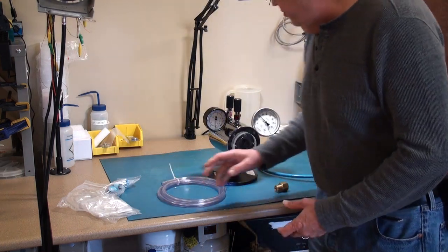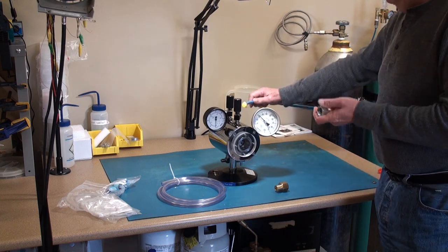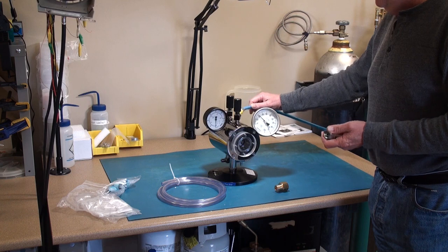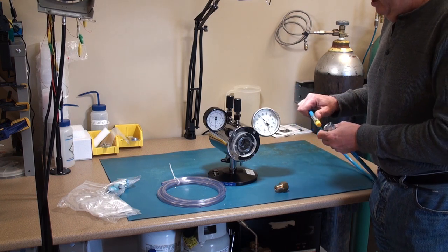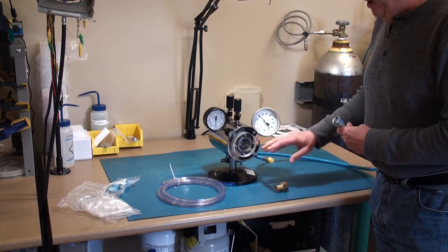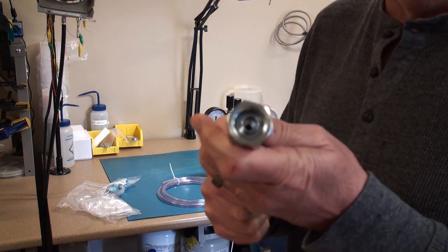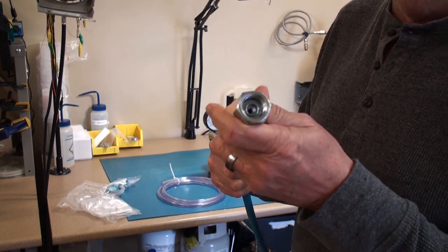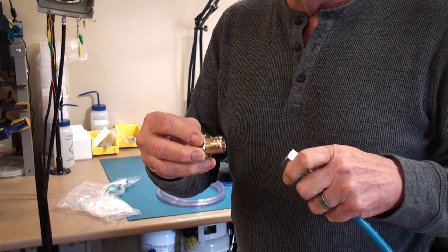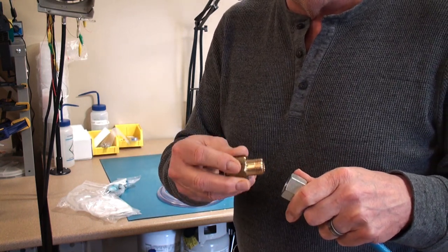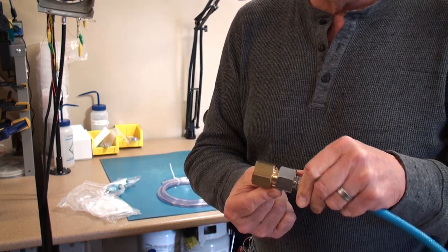In addition to the tubing you have a connection line which goes from either of these top two valves. You can take your pick. I always use the front valve since that one is used a bit more frequently. This is an international setup so this particular fitting as it comes out of the box is set up more for tank configurations from other parts of the world. So we provide an adapter piece. You would put Teflon tape around it just to make the threads get lubricated a little bit and wear better. It also provides a better seal and you would get two wrenches and tighten these two fittings together.